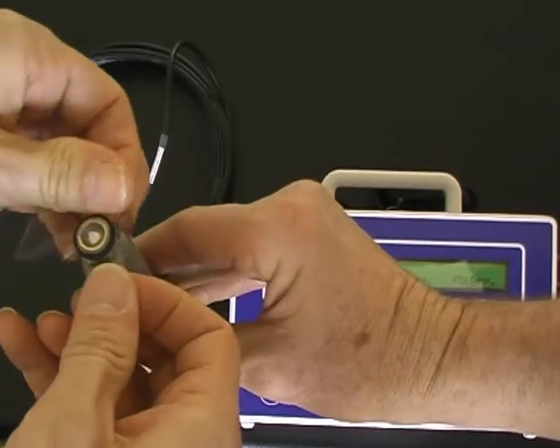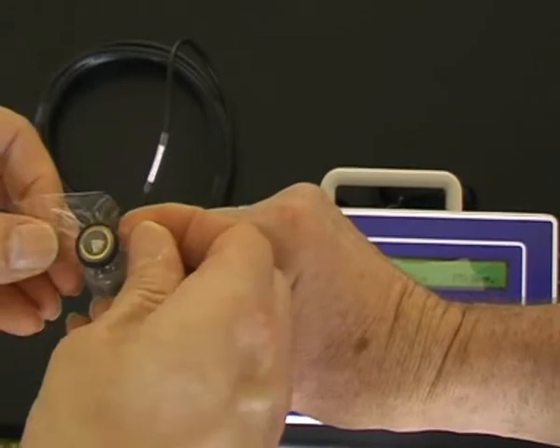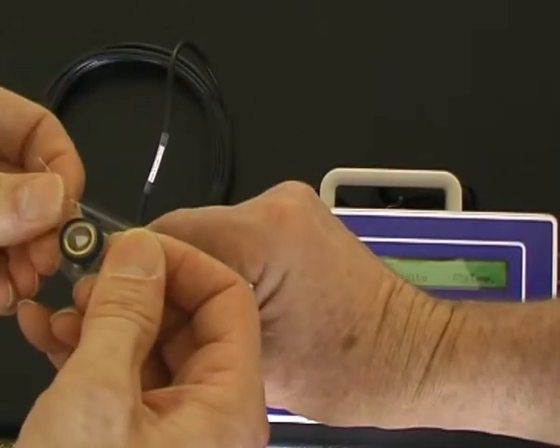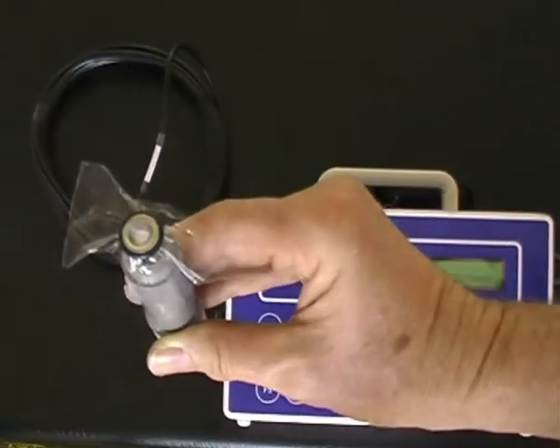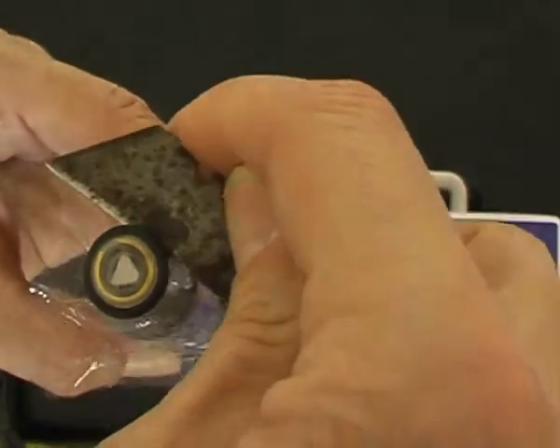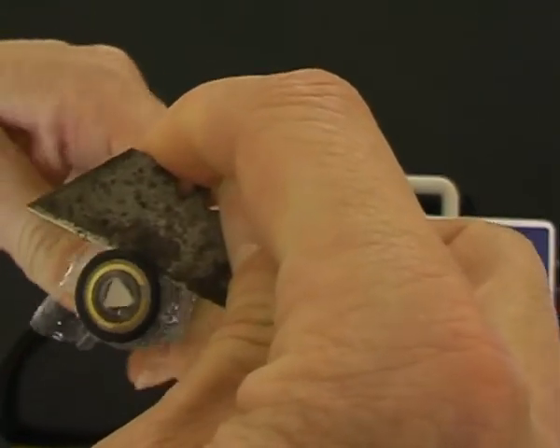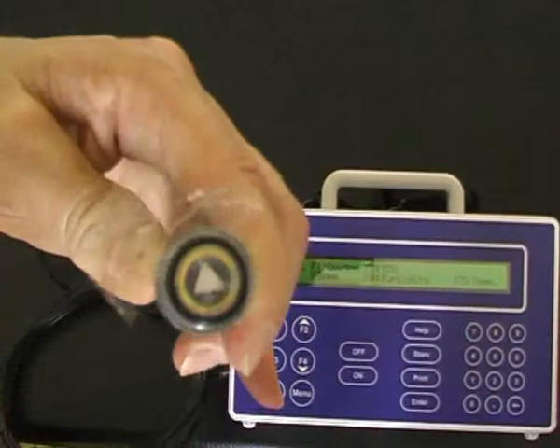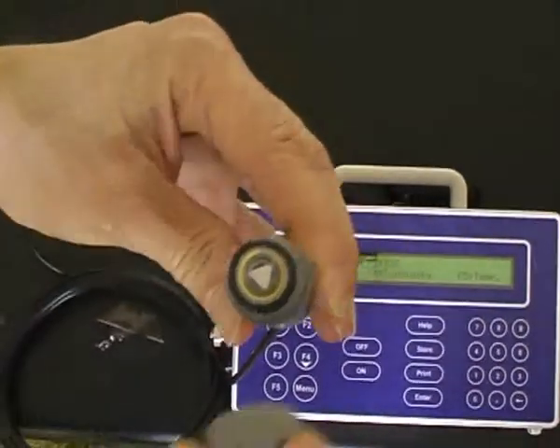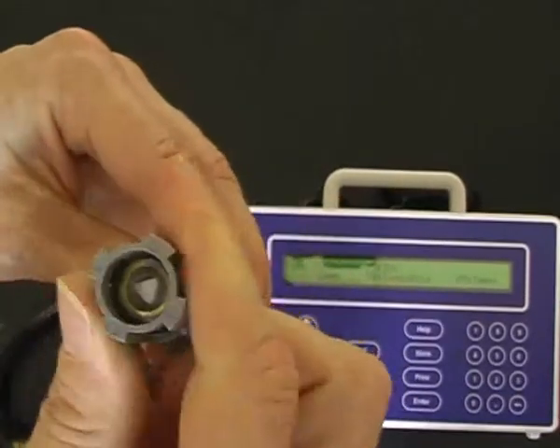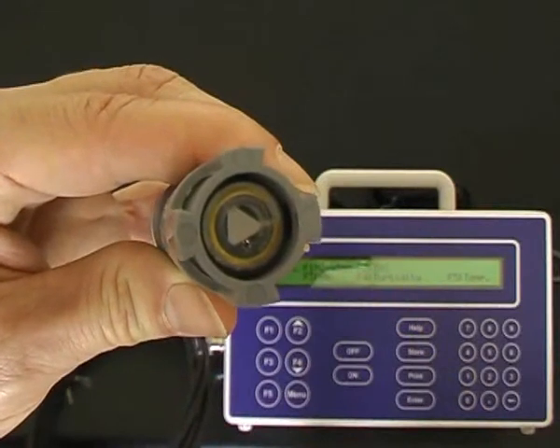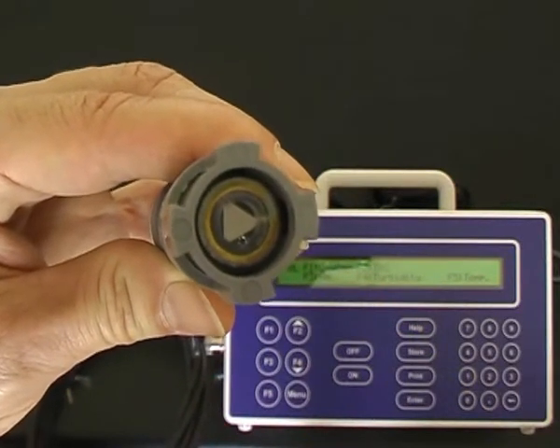Ensure there are no wrinkles in the membrane by stretching from the side and that there are no bubbles underneath. Remove the excess membrane from the sensor with a utility knife blade and refit the guard. There should be no bubbles in the filling solution beneath the membrane.